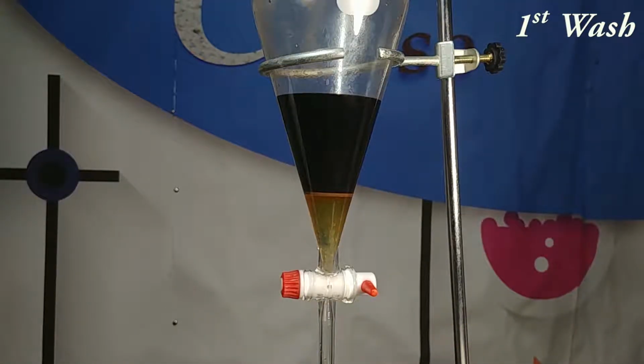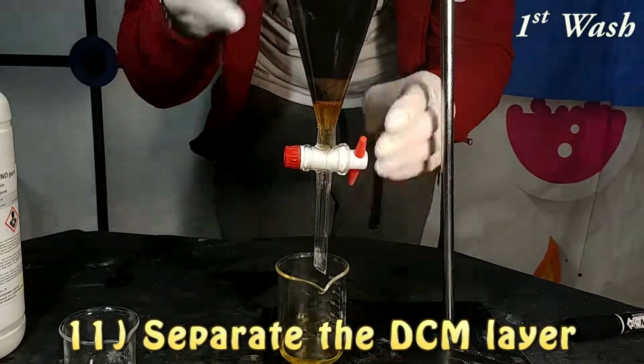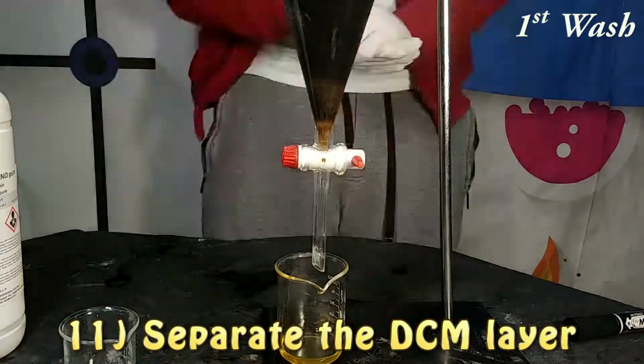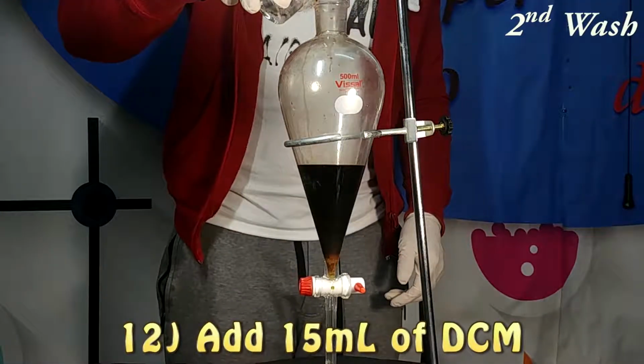The last thing that we have to do is to separate our dichloromethane. In fact, we are going to use our separatory funnel to do that, and we are going to gather everything in one beaker. Remember that in total we have to do this procedure 3 times, by using the first time 15, the second time 15, the third time 10 milliliters of dichloromethane.